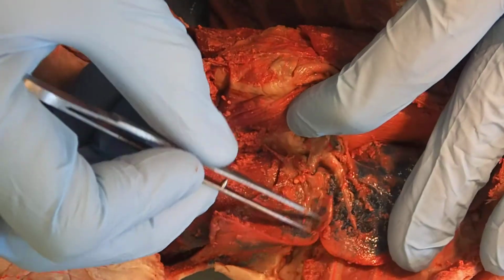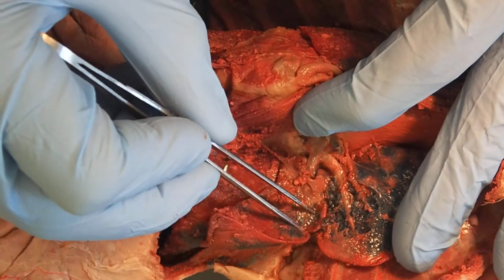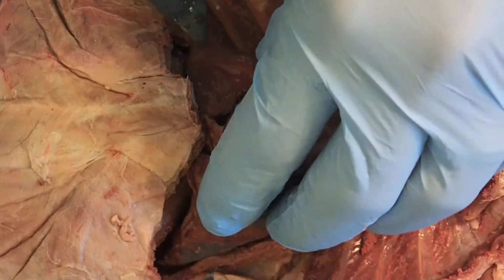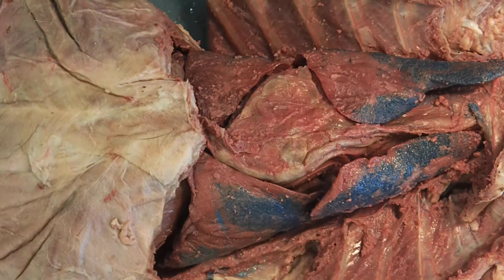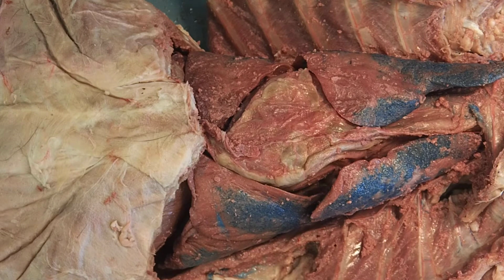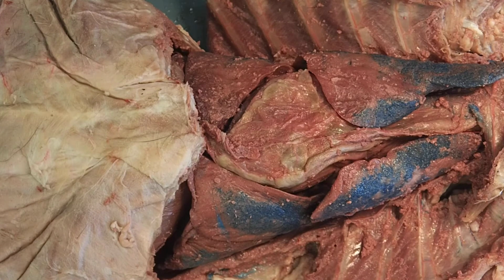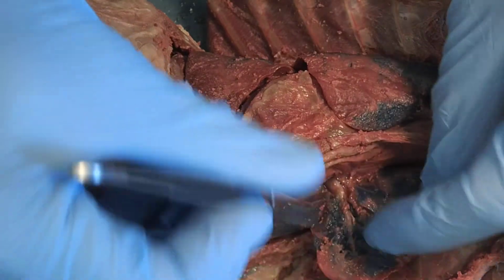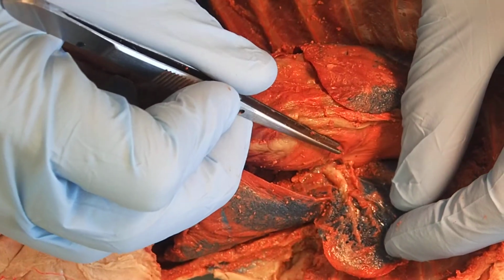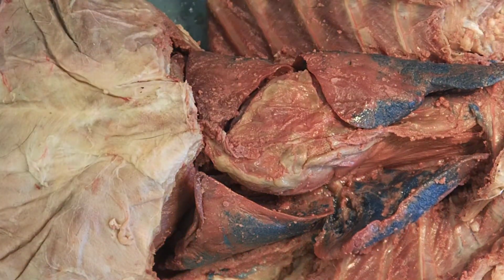And as those go out, you'll even see that those start to branch into tertiary bronchi. And then at the very end of those would be bronchioles. And the bronchioles are then going to terminate into what's called the alveoli. And these are the actual sacs, the sites of diffusion for oxygen from the external environment into the internal environment of the lungs. In addition, you'll notice that there's some red capillaries going in here. Those are coming from the heart. And you'll also see that there's oxygen-rich blood going back to the heart.